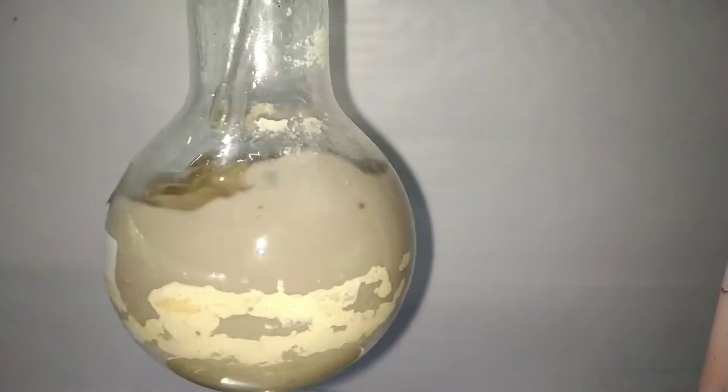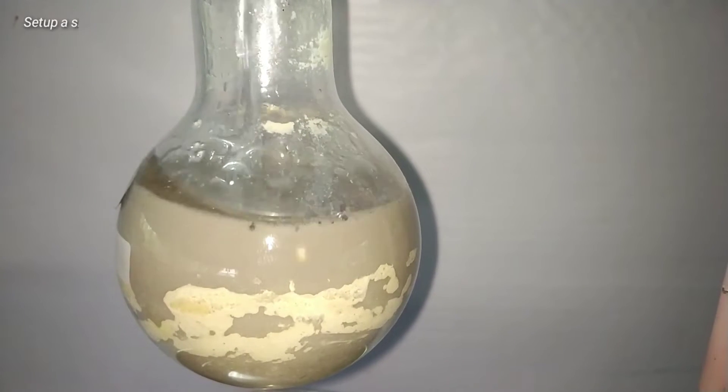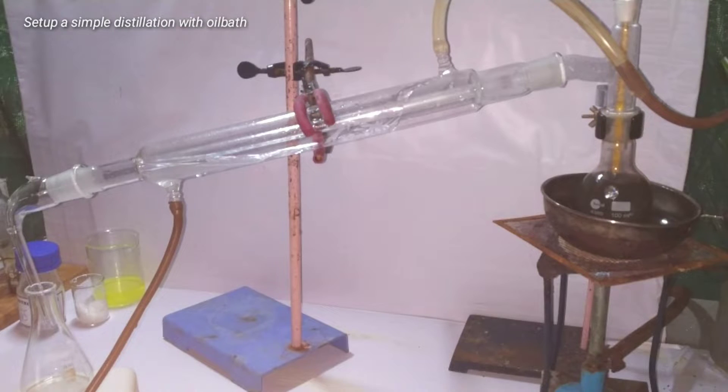Ideally steam distillation of this solution is to be done to separate the aniline, but since the process is difficult, I decided to go with a simple distillation.